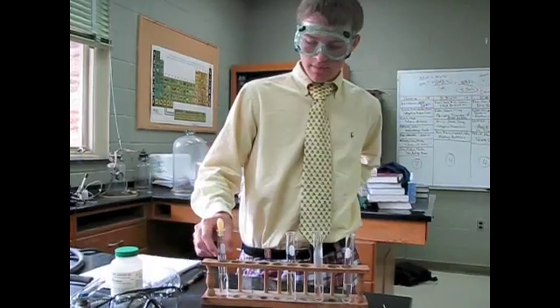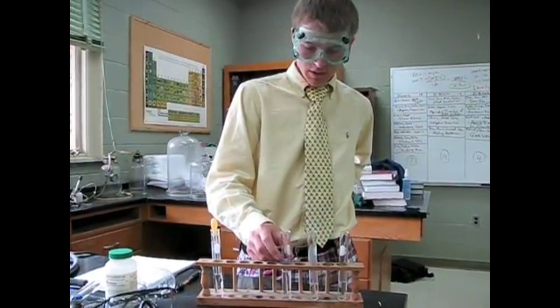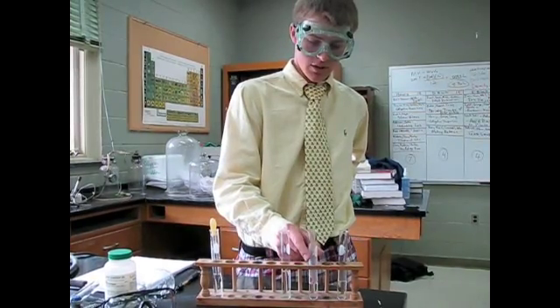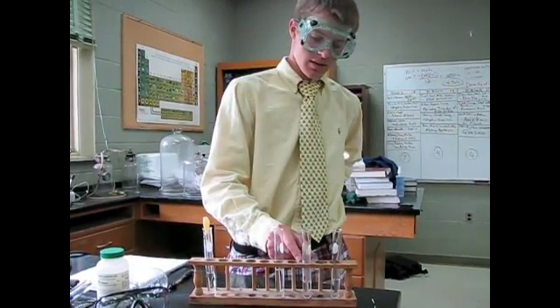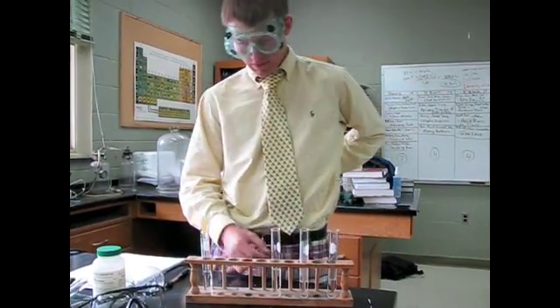Well right here I have silver nitrate and I'll drop five drops into each test tube. Right here I have the deionized water and here's the original mixture of water and salt. And here is the distillate.